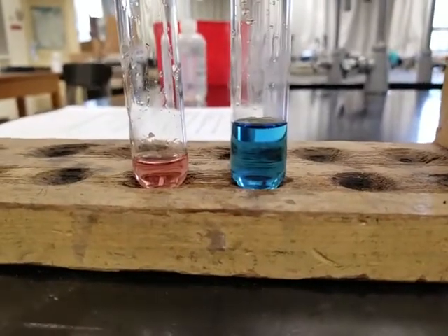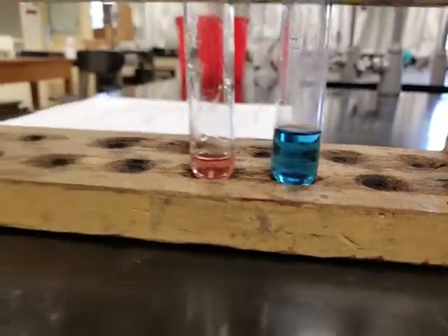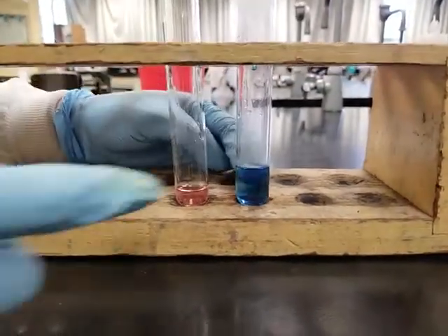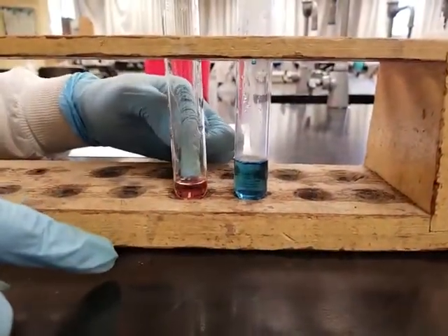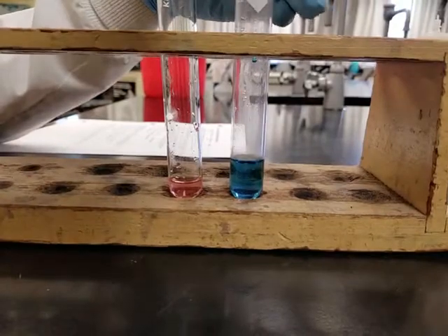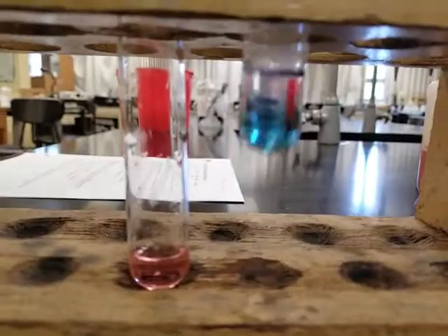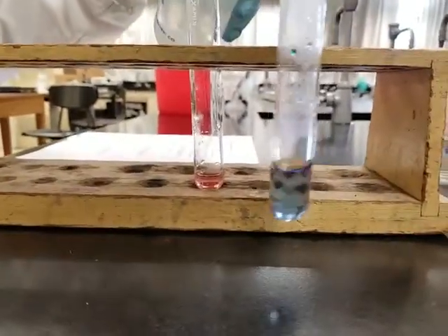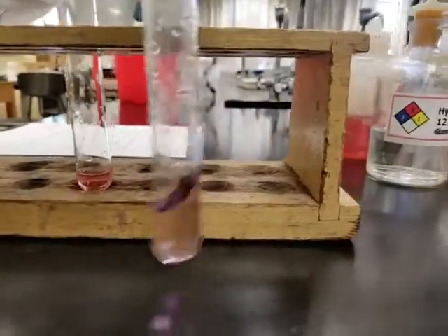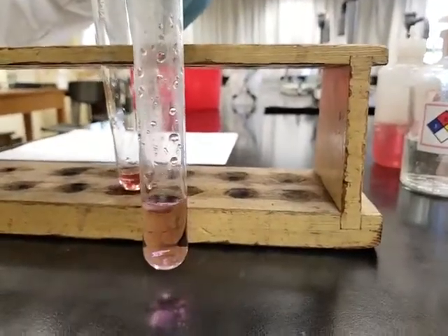Note the color change. And then after that, it's asking you to now drop or add DI water dropwise until the color or the original color is restored. So we're going to keep on adding DI water until it changes back to this color, okay? What color is this? You decide, and then we want to change it back to this color. So let's go ahead and drop deionized water in dropwise. See if we see any changes. Okay, let's have this. I'm going to add deionized water with the good stirring. Okay, dropwise, dropwise.